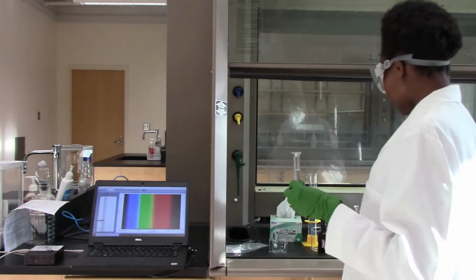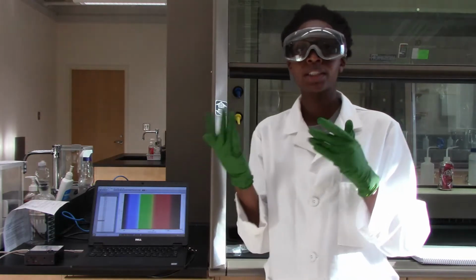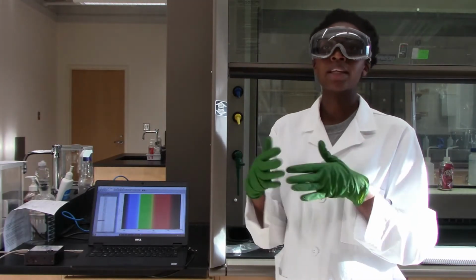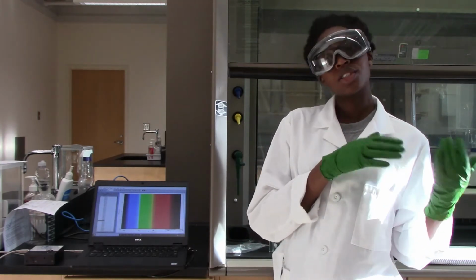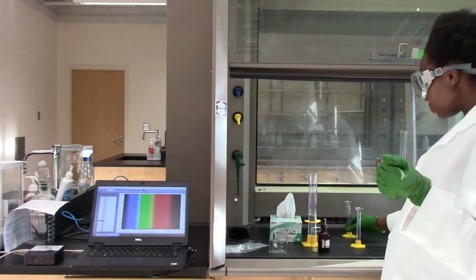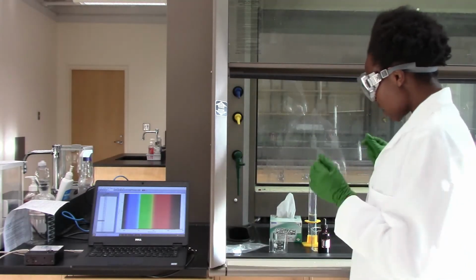So that means I have my initial concentration of 0.068 molar. So for the other successive concentrations, we should have 0.034 and 0.017 molar. To make the dilutions of that, I have to take half of the 0.068 molar and add the same amount of water to that, just to dilute it by half. Anyway, so I have my initial 0.068 bleach solution.